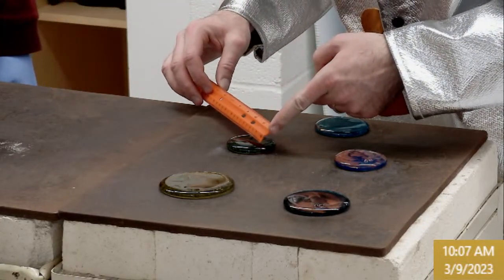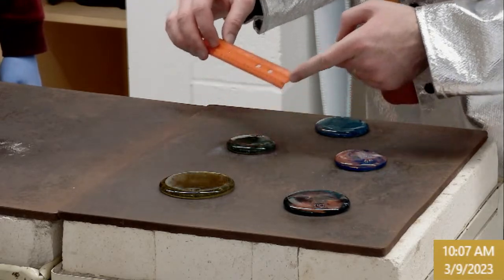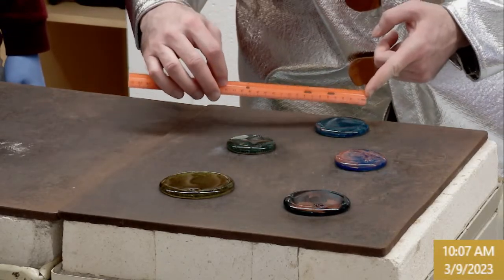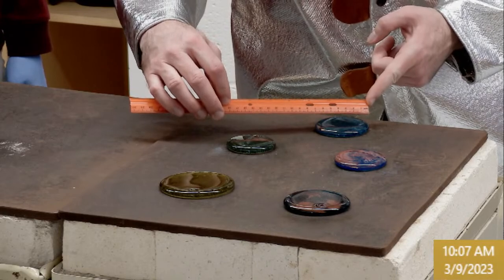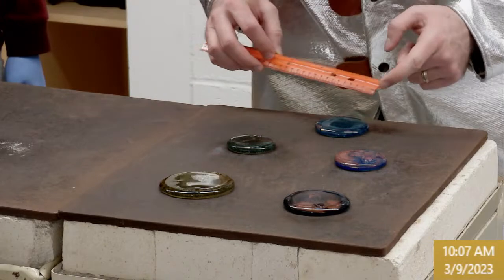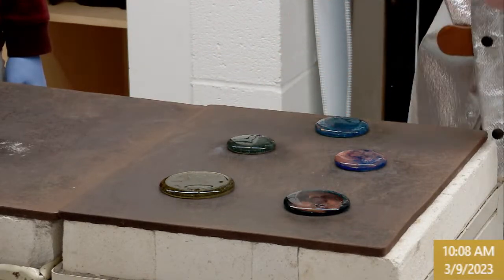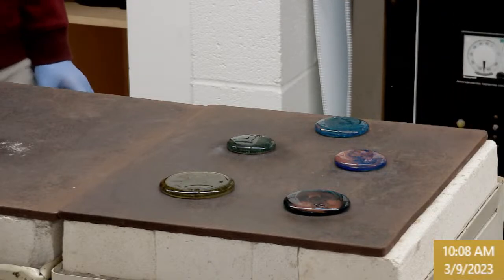This one's approximately 58 or 59. Let's call it 59. And these are approximate because I'm not touching. So we'll have to remake if they survive. This one's crazy hot, burning my finger. That one's around 64. So those are preliminary in case they shatter.